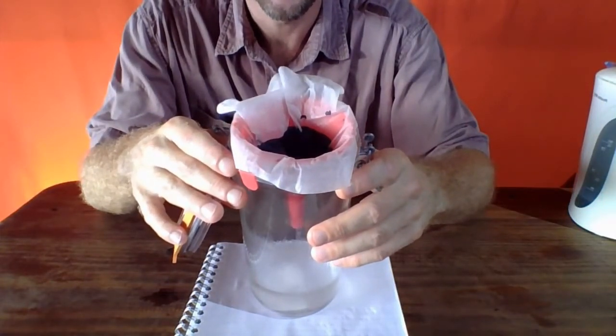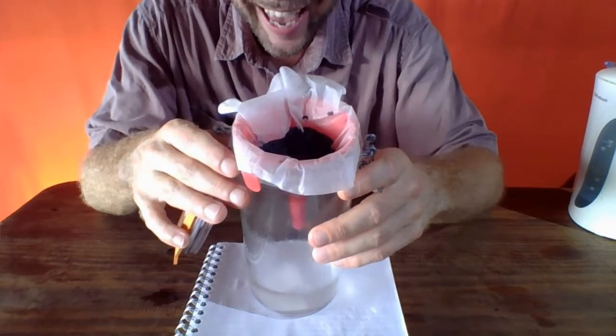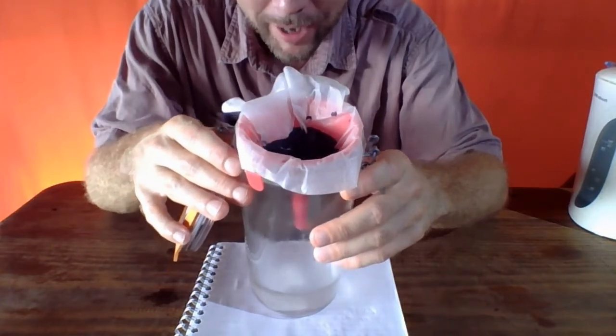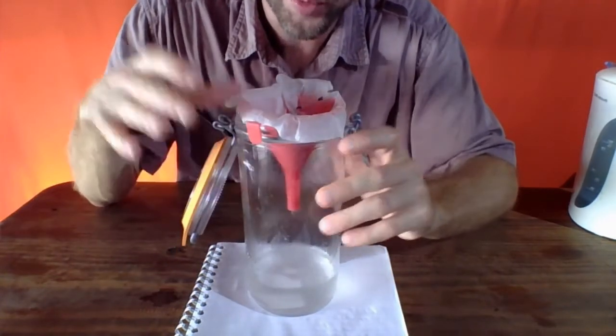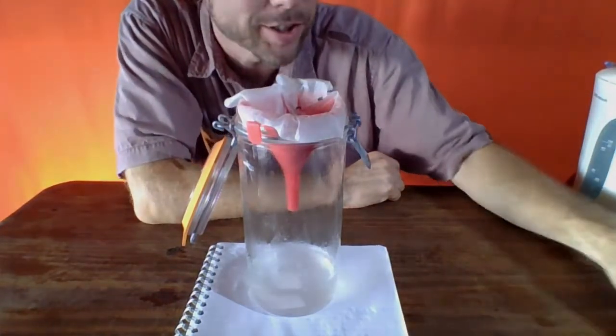As I start to tilt it over, being careful not to tilt too far because I don't want to spill anything, but just to give you a look, it's looking pretty black in there. I'm not seeing a lot of those white crystals that were present initially, the salt.